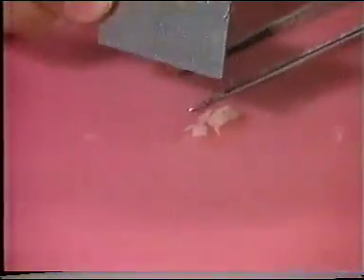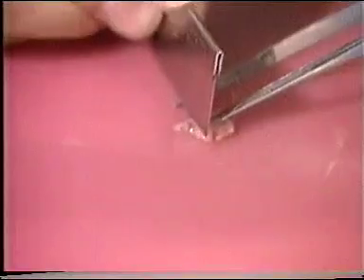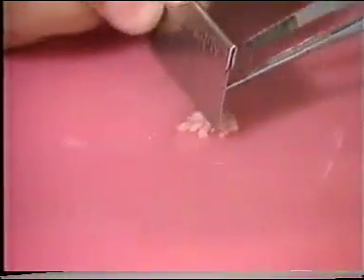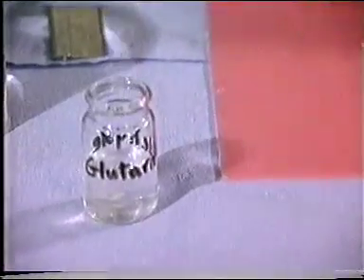In electron microscopy today, a technique of double fixation is used. The first fixative is glutaraldehyde. This penetrates tissue very slowly, so small pieces of pancreas are cut, ideally about 1 millimeter square. This enables the fixative to penetrate all parts of the tissue. Glutaraldehyde contains two free aldehyde groups, which cross-link with amino groups in proteins, and so fixes these in the tissue.